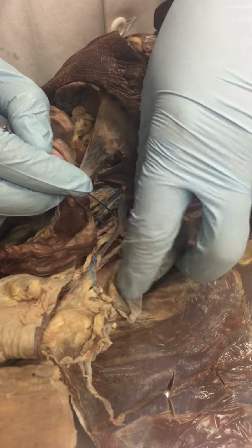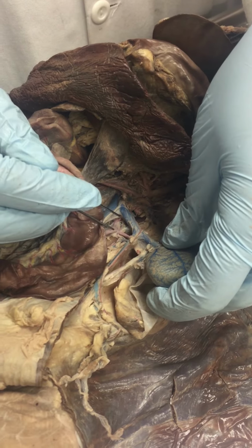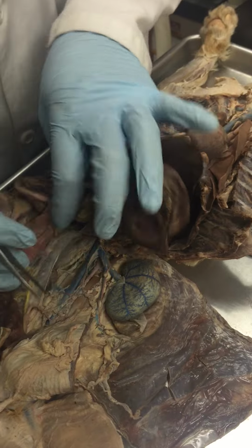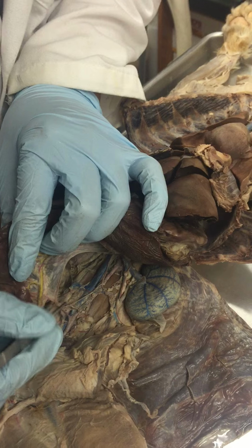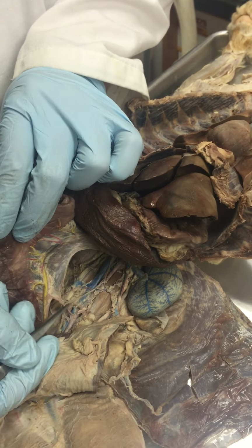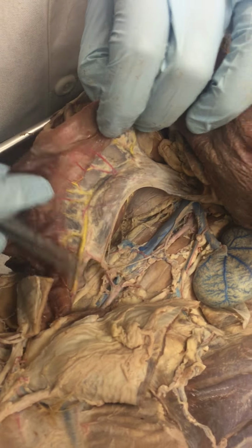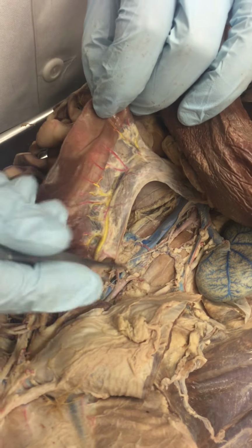And the next one will be the one that supplies the kidney. It's called the renal artery. That's a really easy one, because if you see the kidney and the one that goes in, that's the renal one. Okay. The next major branch is this one. It's the inferior mesentery. That supplies mainly the large intestine part, the colon and the rectum. You can see this one goes here and supplies this region. Okay, this one.